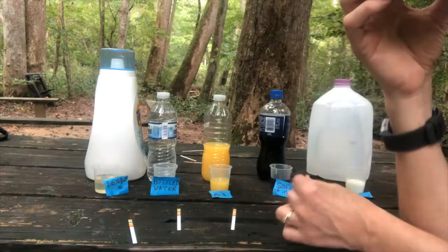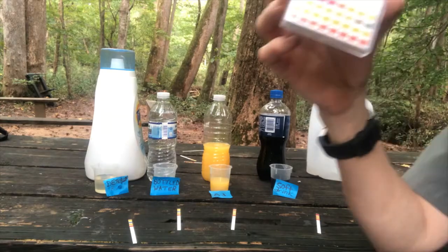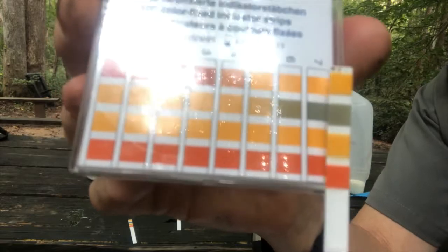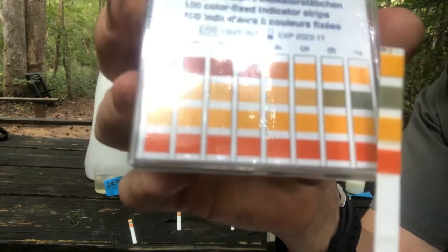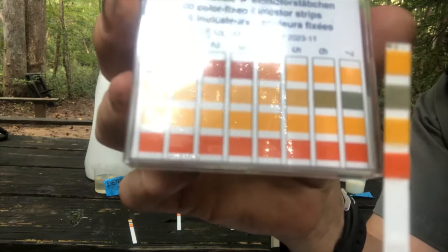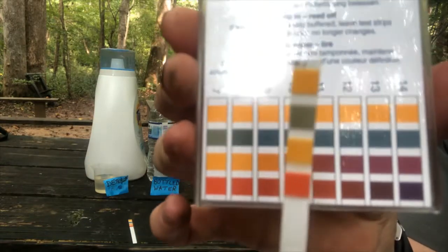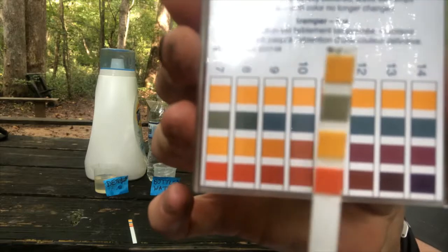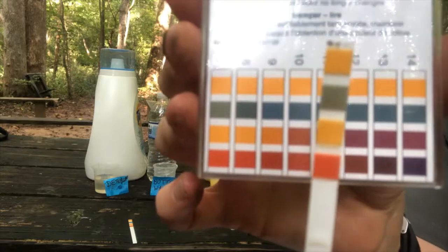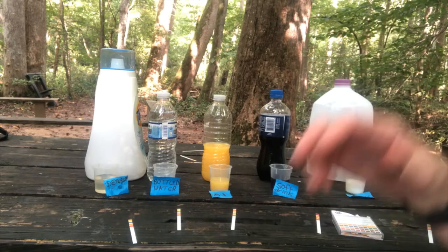All right, that's a soft drink. Finally, we have milk. Write down that soft drink one for sample 4, what the pH number turned out to be. Now we'll look at milk. We got green. And with the 0 to 7 side of the box, we have 6 and 7, both have green. So see if that looks good. You can also look at 7 to 14 over here. See if there's another shade of green that matches better. Okay. You have your number. Write it down for sample 5, milk.